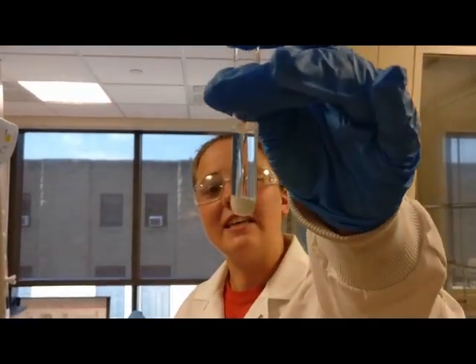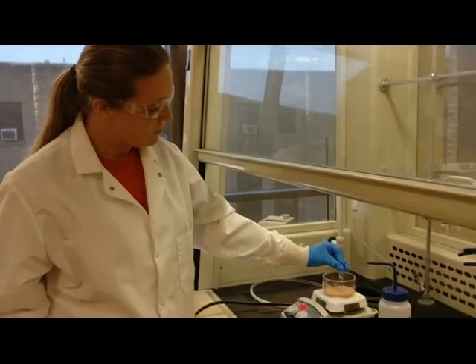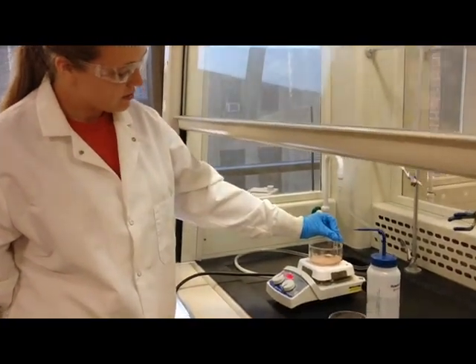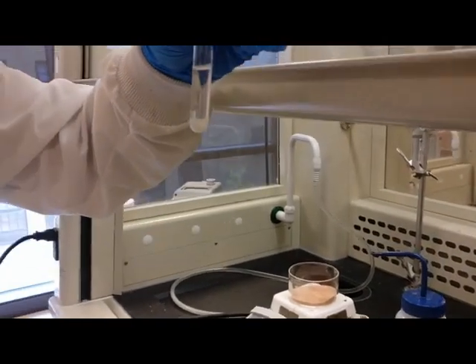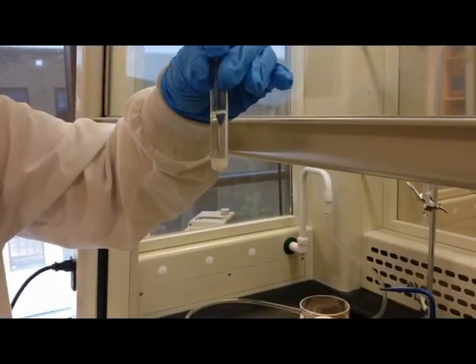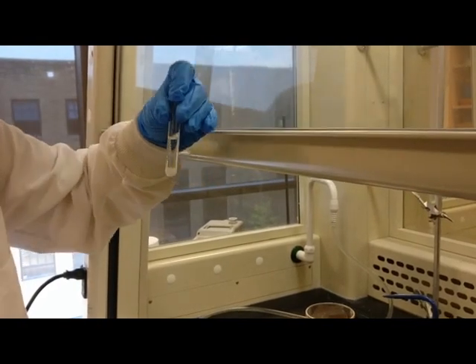But then as you can see here, the solid is not dissolved. So this solvent may work, but we still have to heat it and check. So when we put it into a sand bath, if it doesn't dissolve, that means there's too much bad solvent in there. Which means it's also unusable.